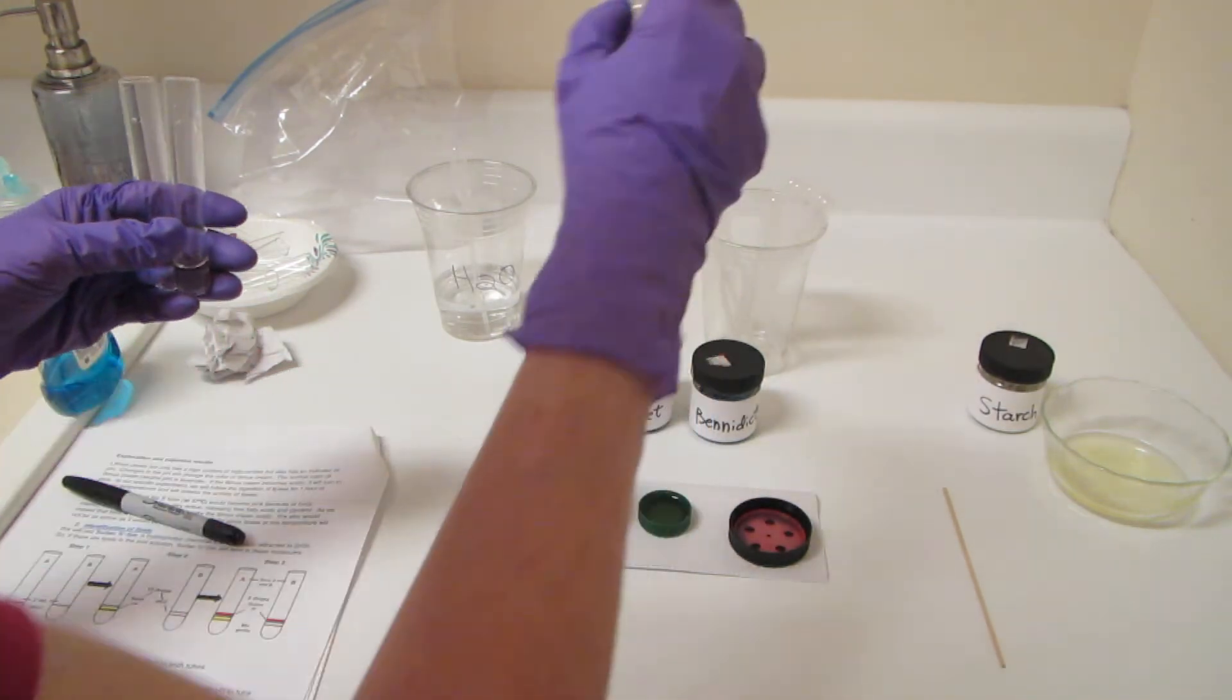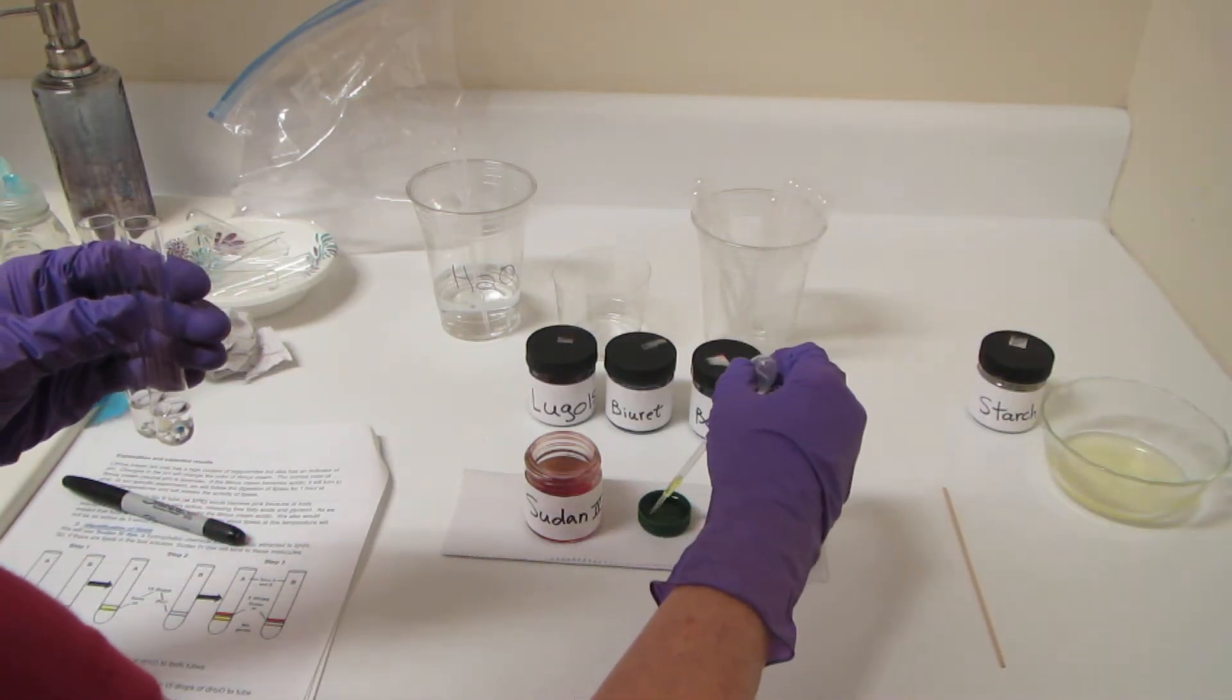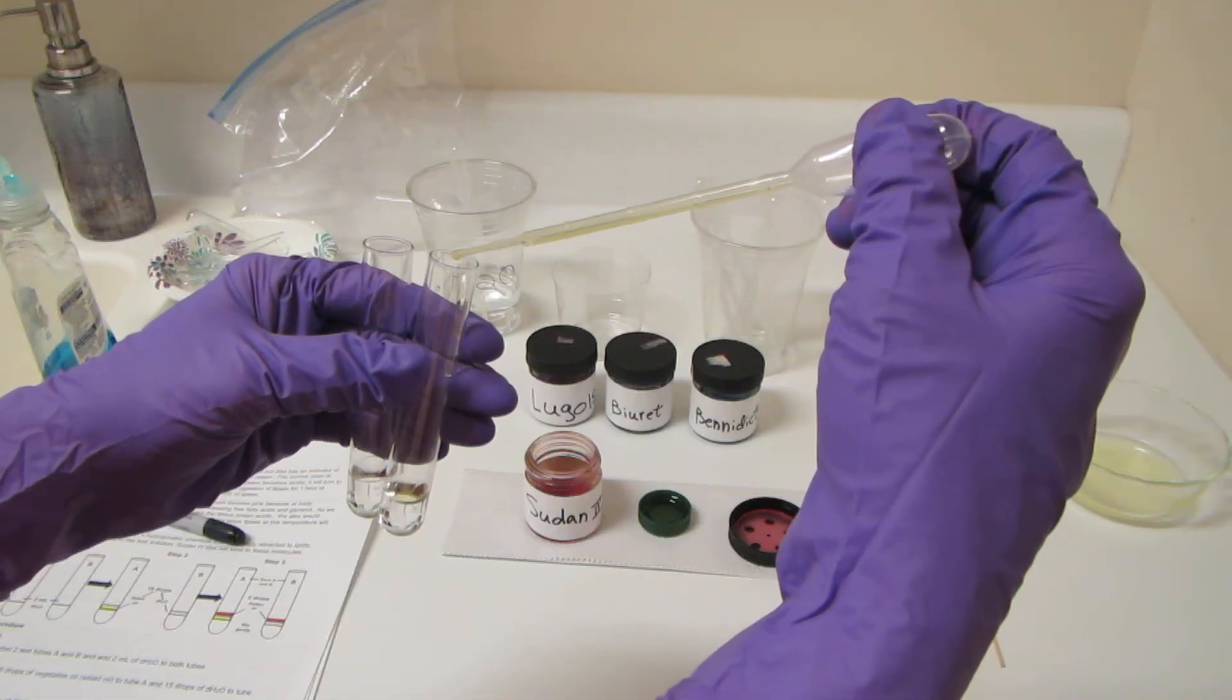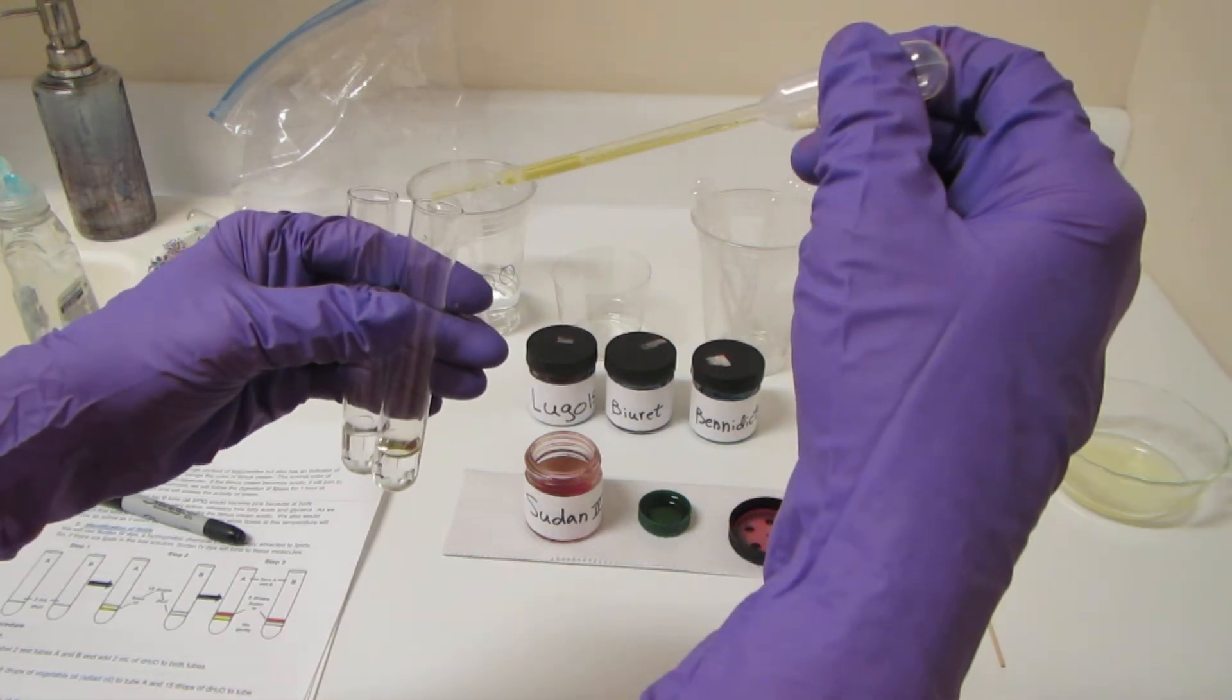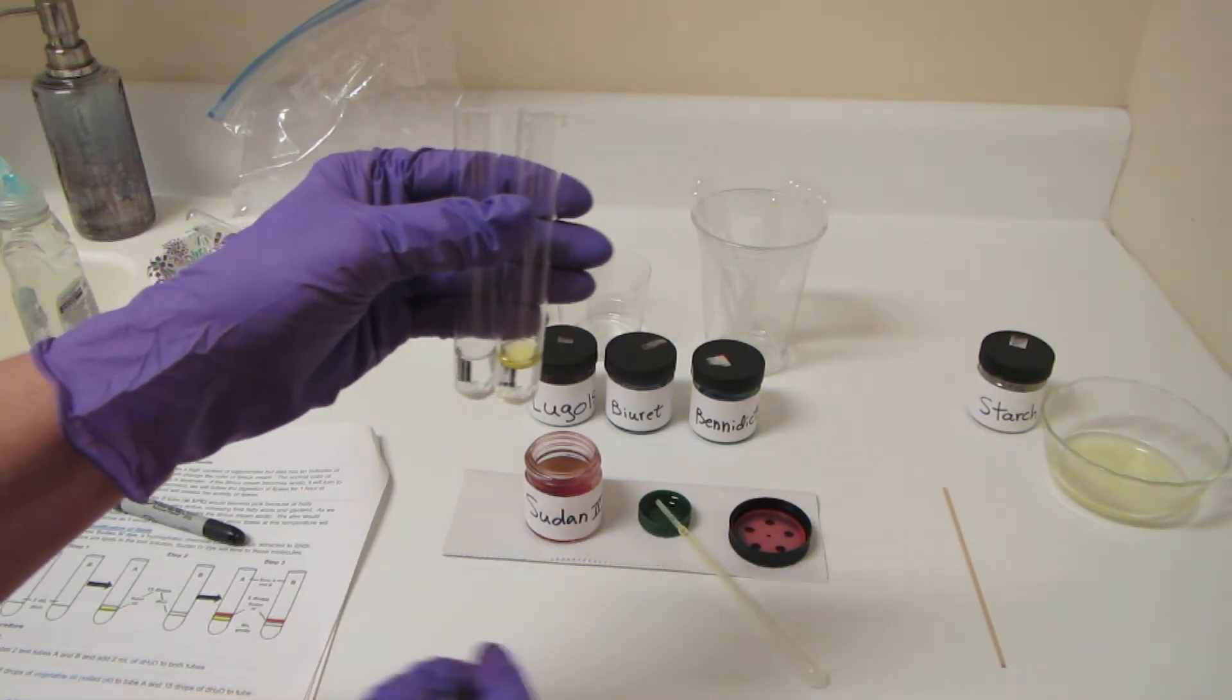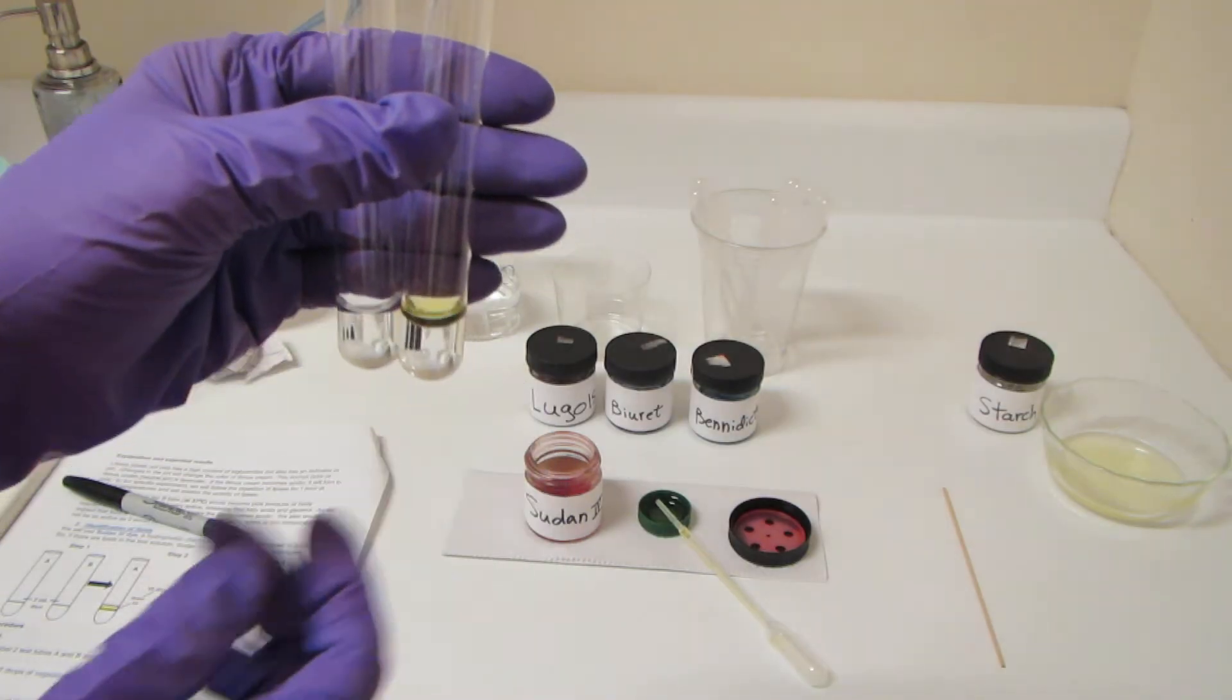Now, what I'm going to do is go ahead and place some vegetable oil, which I happen to have right here, in only one of the tubes. So I've got 15 drops of vegetable oil in this tube here, and I have nothing but water in the other tube.